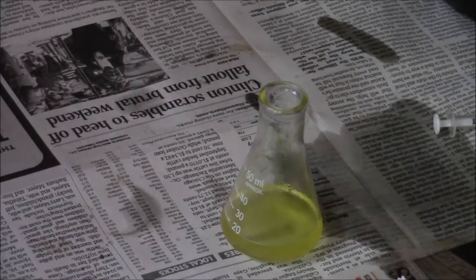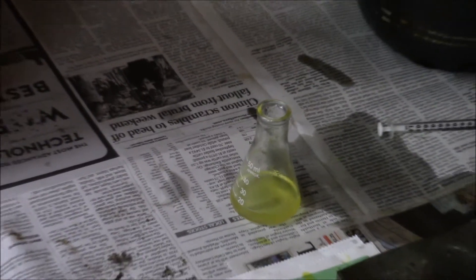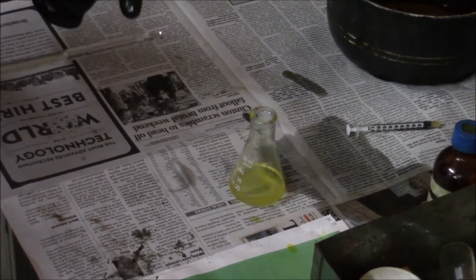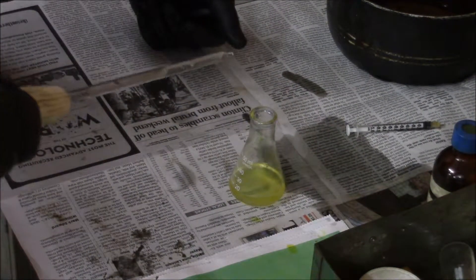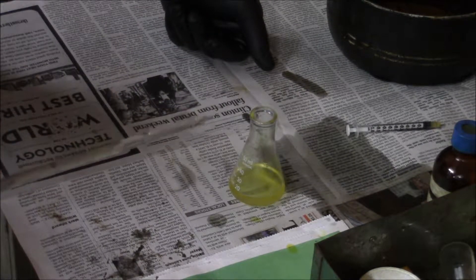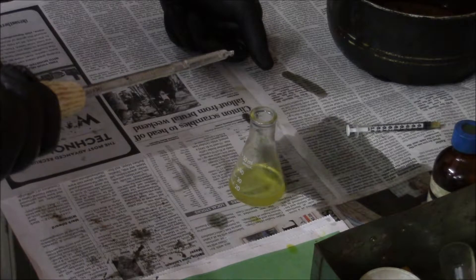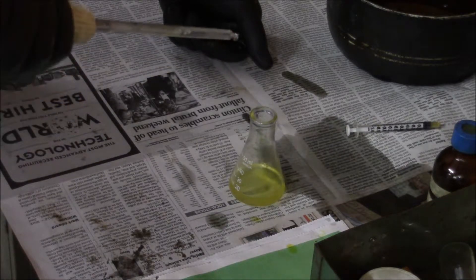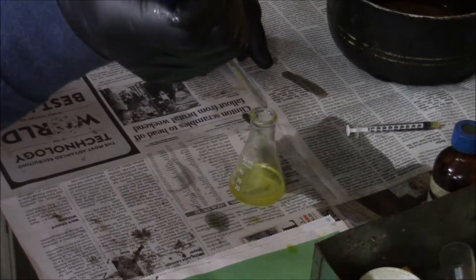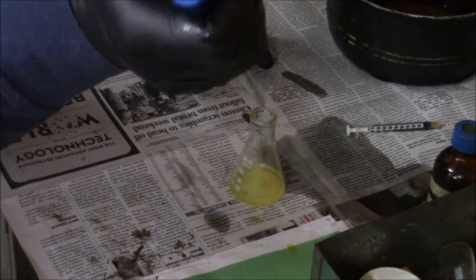We're going to see how many milliliters of product it takes to turn this back to that pink color we had at the 8.5. Then we'll reference that number and mix our methoxide accordingly. This pipette will suck up about 2 milliliters at a time. I normally add about half a milliliter at a time — I think adding one drop at a time is a little unnecessary when you're talking about grams per liter. Counting from where the top of the mark was — that's a half a milliliter.